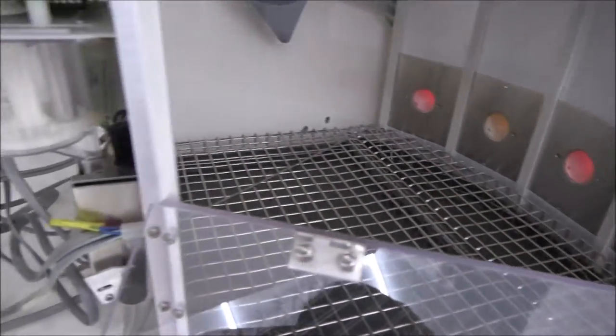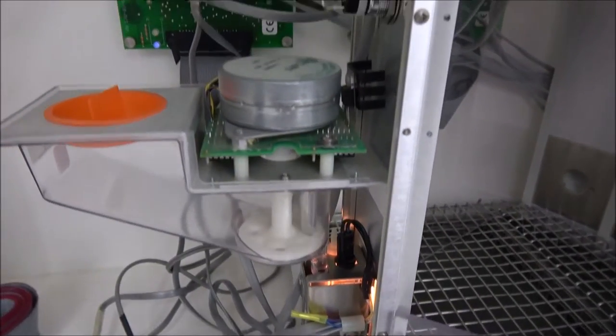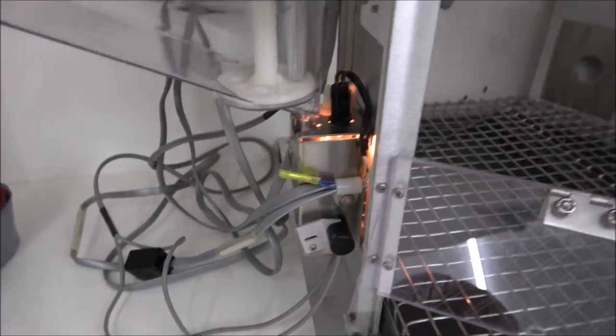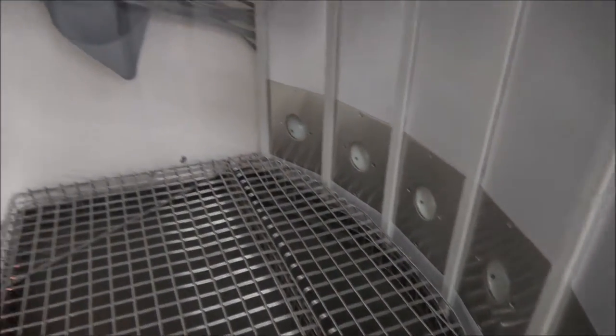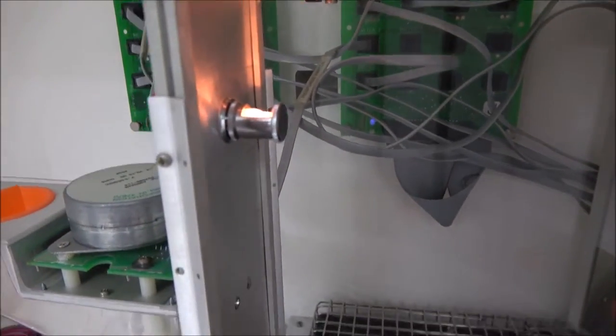This is just to show you that everything is working. The pellet feeders—we just wrote this program just to run continuously, so everything is just doing a loop. But you see the house light there.